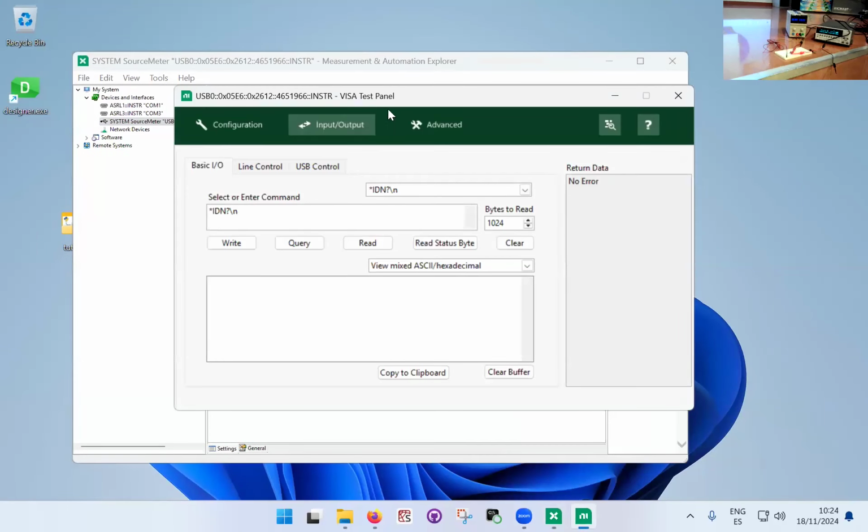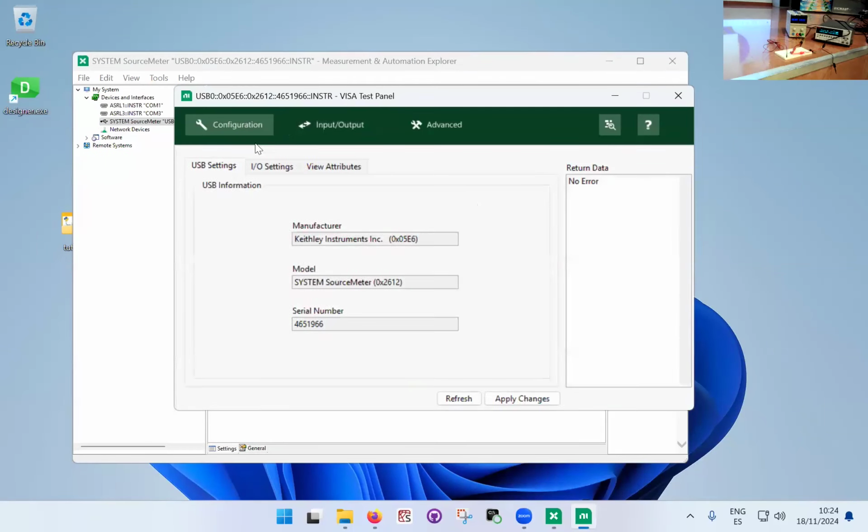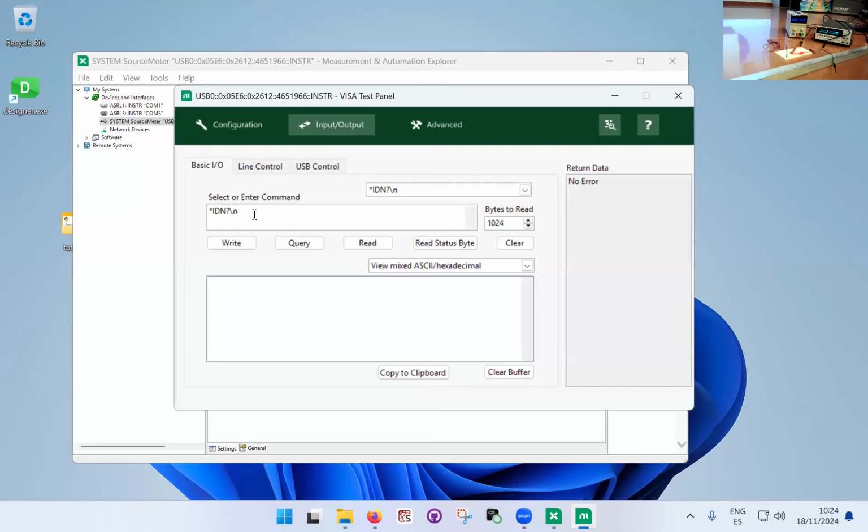So the Visa test panel. You have the configuration. Generally, don't touch anything here. It's not necessary. You just go straight to the input-output, and so you see here that we can enter commands, and we can use this interface to write, read, or query. Query is to write and then immediately to read. So it means that we're using a command that we expect a response to.